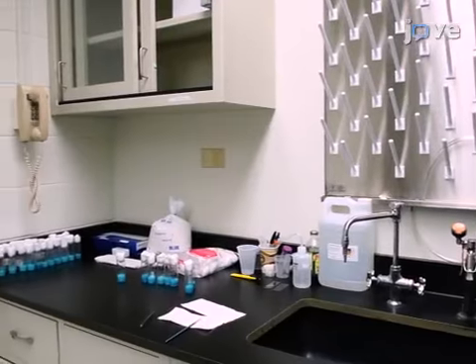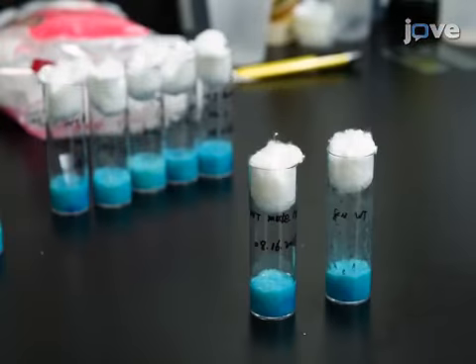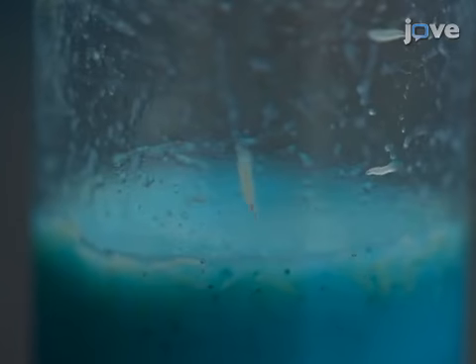When producing the flies for this experiment, allow reproductive parental flies to mate and lay eggs in a fresh vial for 8 hours. Thus, the clutch of eggs laid will develop into flies of a similar age.